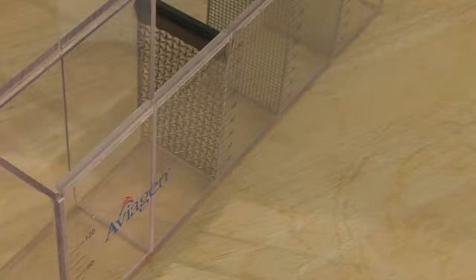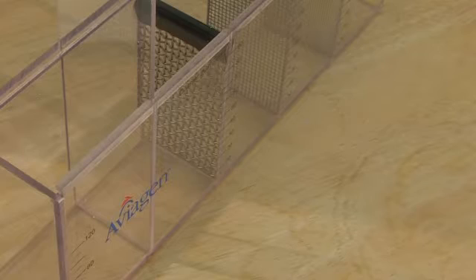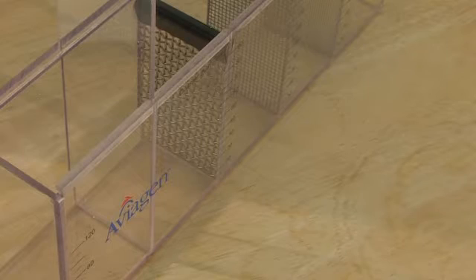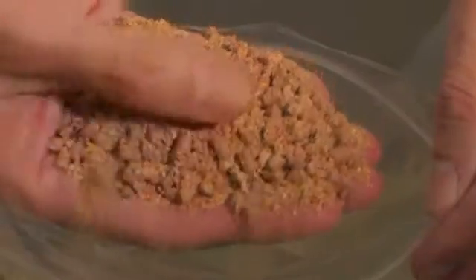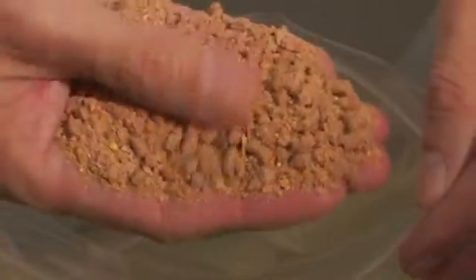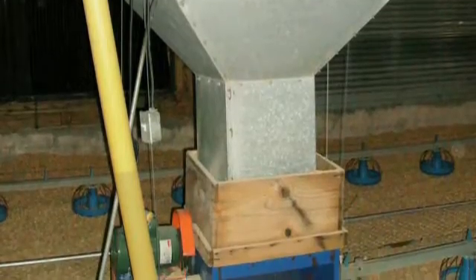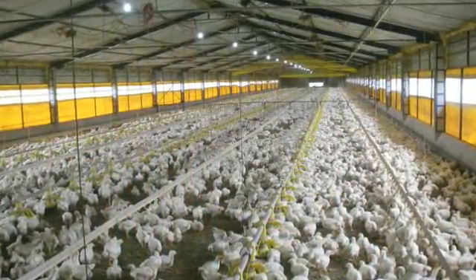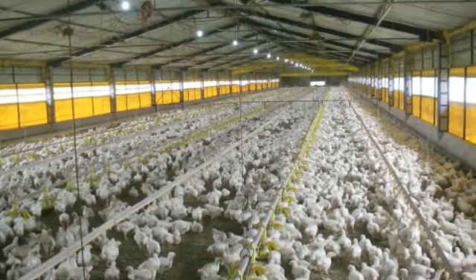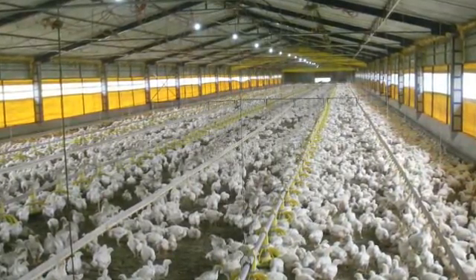The method of taking the feed sample is important, as this can have a major impact on the result. The aim is to get a sample that best represents the physical feed quality that is presented to the birds. Generally, samples should be taken from the hopper closest to the feeders. Sometimes it is necessary to take the sample from the feeders themselves — for example, if a long auger is used to supply the feed to the feeders.